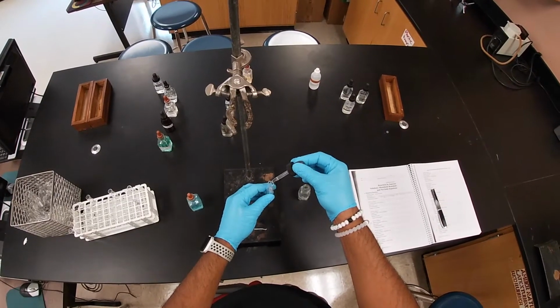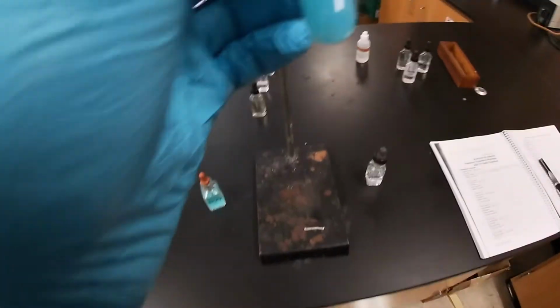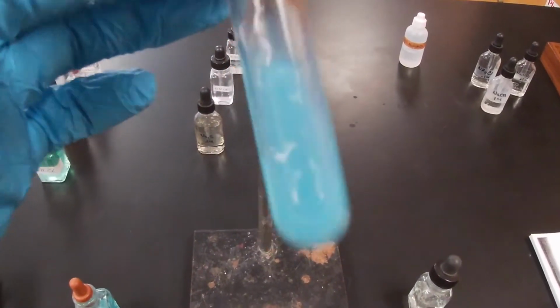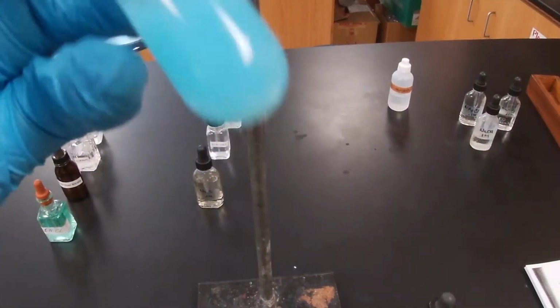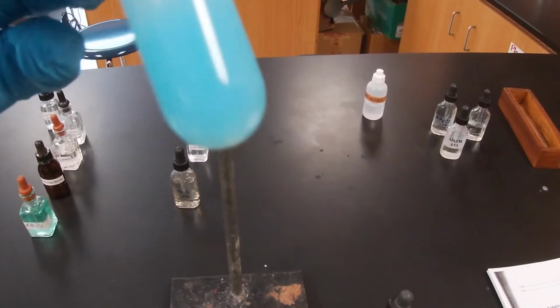Let's add a little bit more, see if it changes here. Let me get it close to you so that you can see it. It created a murky substance. Once we mix those two solutions, if nothing had happened, we would have ended up with a clear solution. But this murkiness tells us that there is something that is no longer soluble. We have two see-through solutions, and then all of a sudden we get a murky one. So go ahead and determine your precipitate.